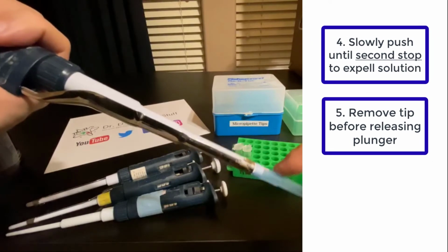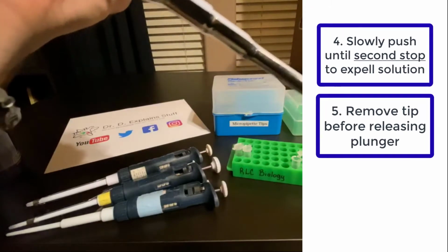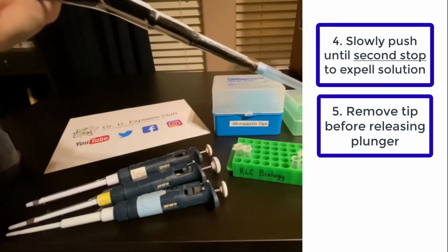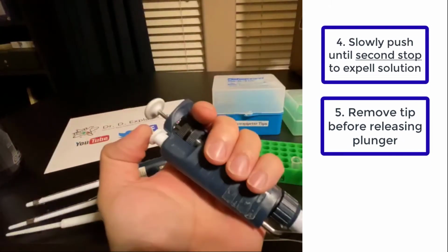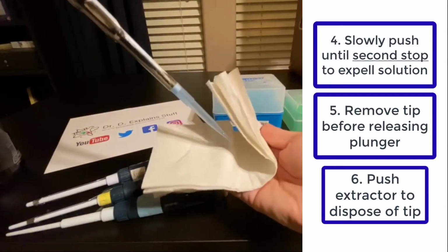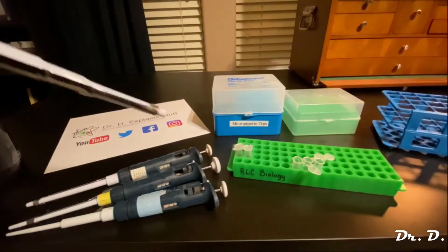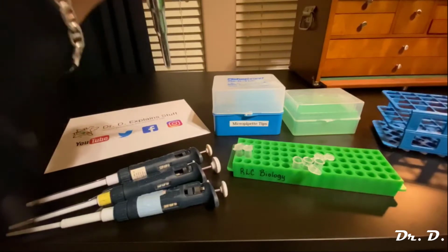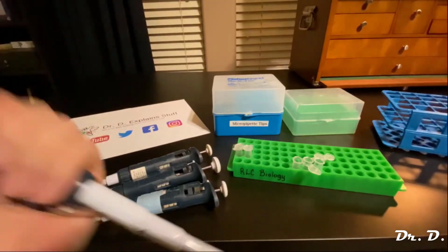And what do I do with this tip? This tip is disposable. So to dispose of it, you simply grab a container. Do I have a container here actually? I'll dispose of this napkin later. But if you push this other button here, this is called the extractor. And when you push that, notice what happens. It just extracts the tip, and the tip goes flying somewhere where you can't find it. So just make sure you're pointing at the trash receptacle, and then you push the extractor, and that will extract the tip into the trash. Okay? So that's how you do it.